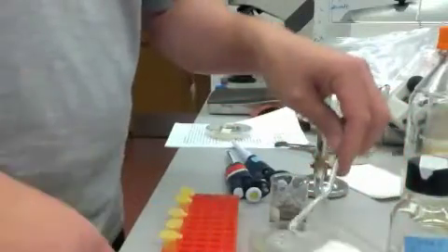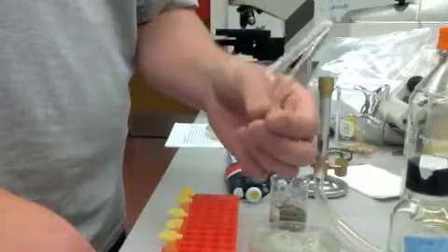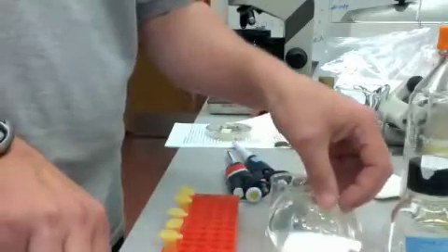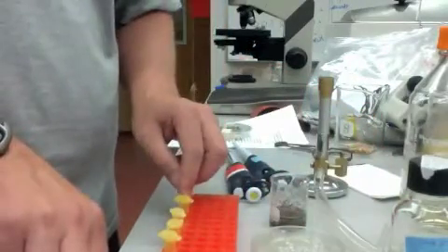You'll be given a hockey stick or something similar and some alcohol to sterilize that in. And then, of course, you've got your plates that are ready to go, multiple plates that go with each of these dilution tubes.